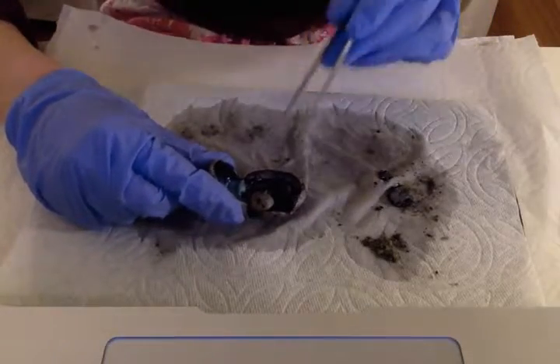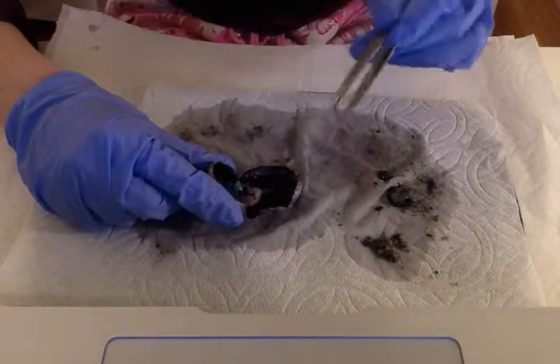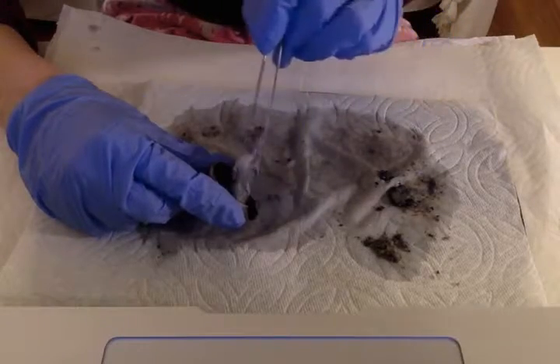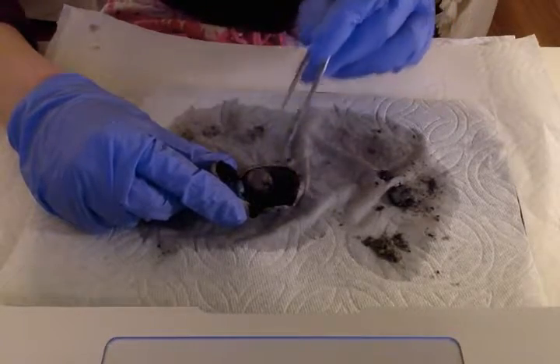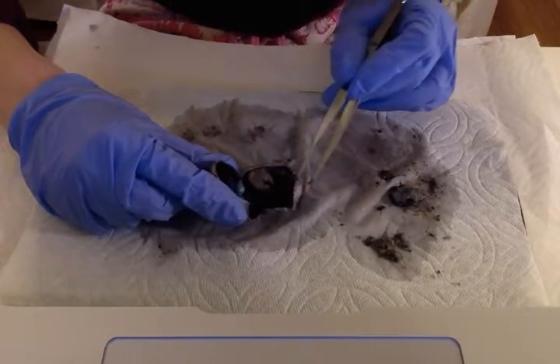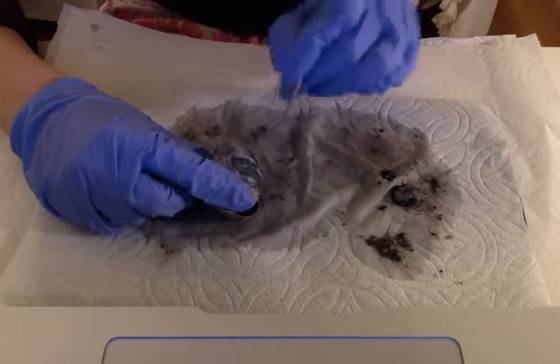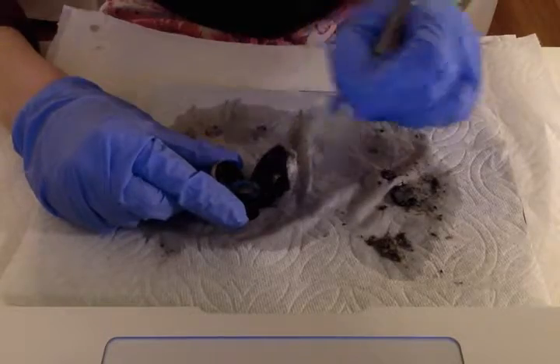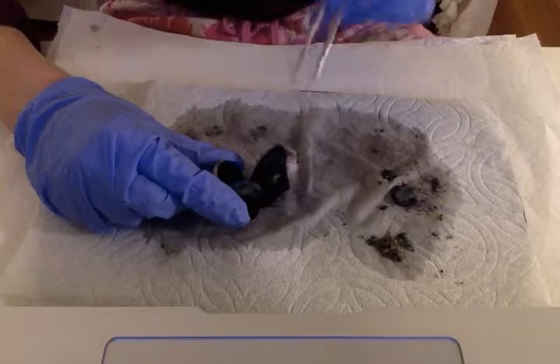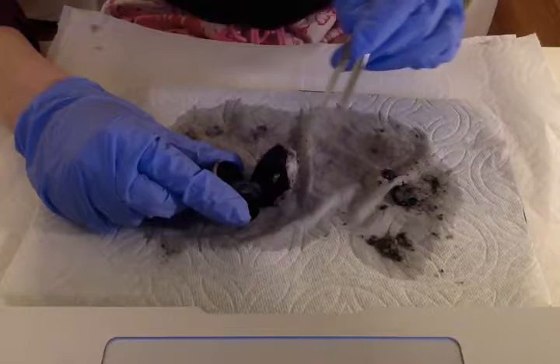Okay, the entire eye is surrounded by this tough connective tissue called the sclera. The sclera is the white portion of the eye that extends even in front of the lens. It is made up of collagen and elastic connective tissue, and its job is to cover and protect the entire eye. You can see some of the sclera here, and obviously we have it on the outside here, where when I had to cut away all the tissue, it was firmly attached to the sclera. The sclera is kept moist by a thin, clear mucus membrane called the conjunctiva.